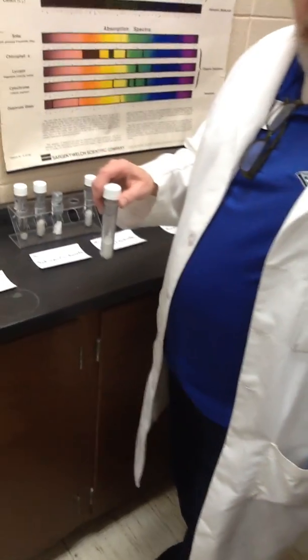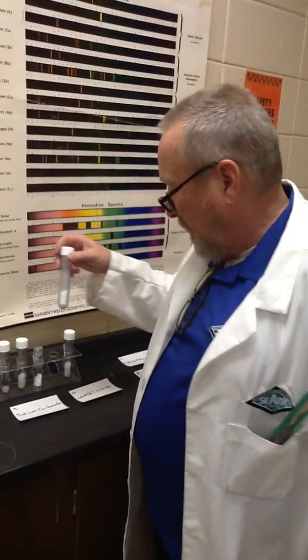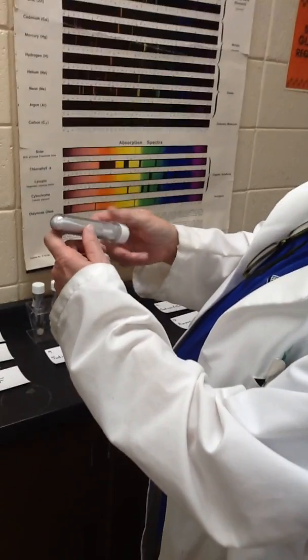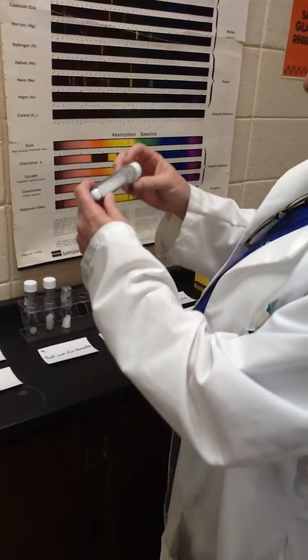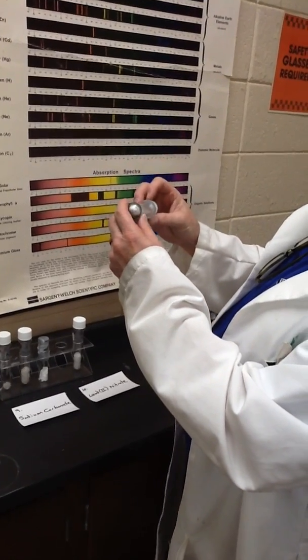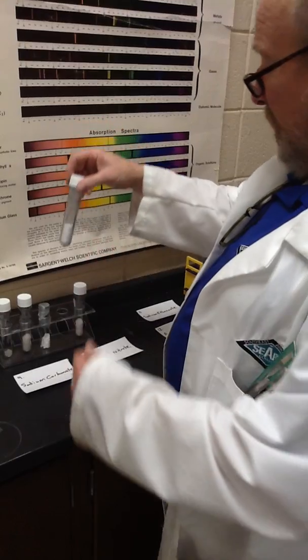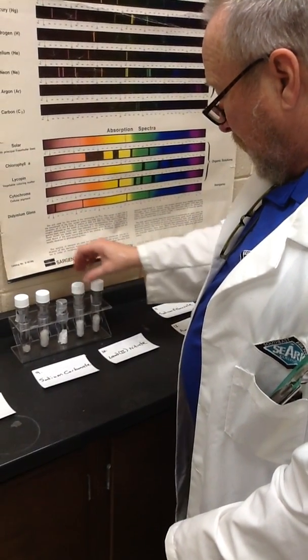For it again. Yes, it started again. Okay, number 9 is sodium carbonate. Here it is. I don't know what to say about it. I have noticed it has kind of a soapy feel. I have to investigate why that is when it's dissolved in water or when I'm cleaning up after it.